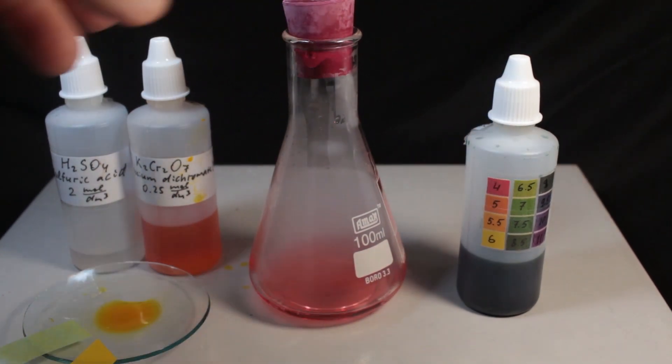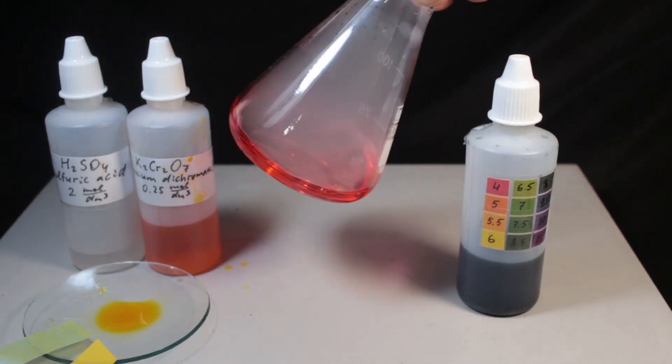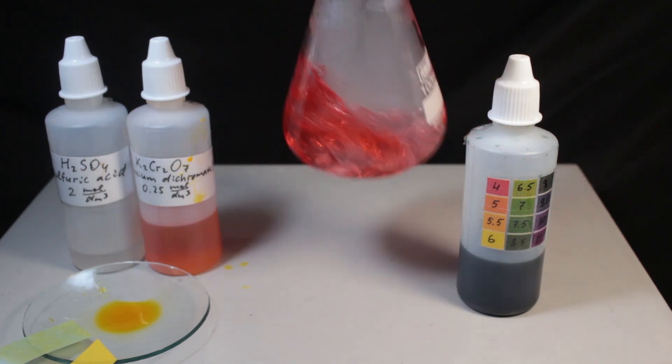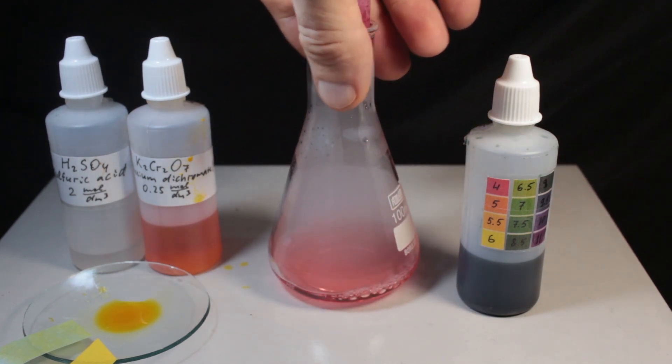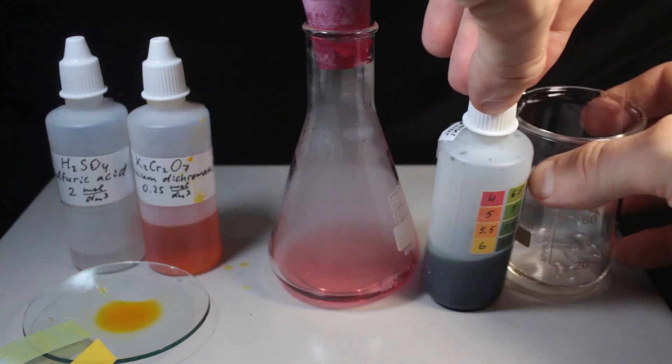Even no need to mix it up. Still we can mix it up a little bit to make sure. pH is definitely at least 4 or maybe even lower, because 4 is the limit of this particular indicator.